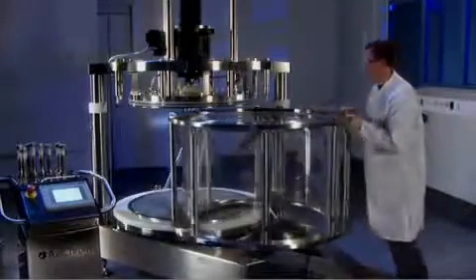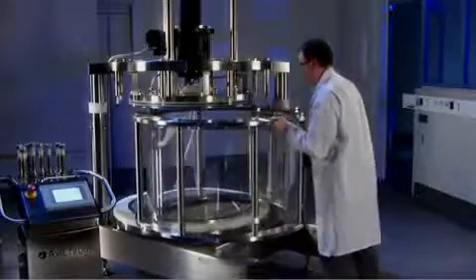Reassembly is just as easy, but in the reverse order. Even large diameter column tubes are easily moved on hinges.